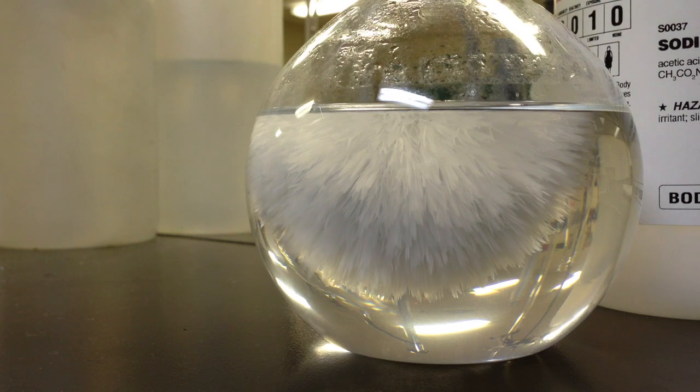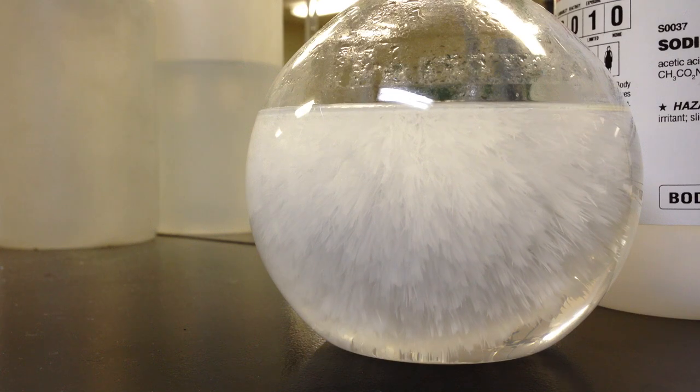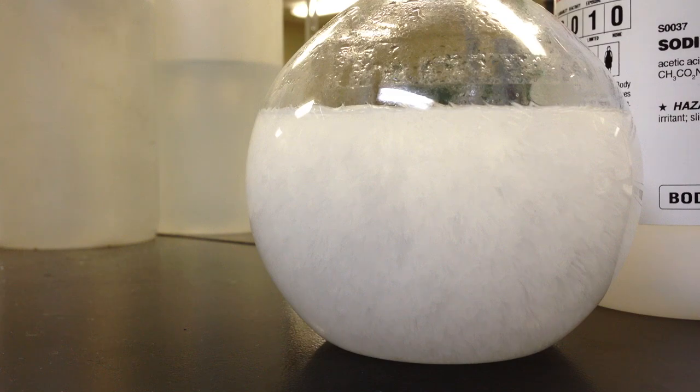So we see that the sodium and acetate ions recognize the crystalline structure of that seed crystal I just added. And they add to it, and we form one big crystal.